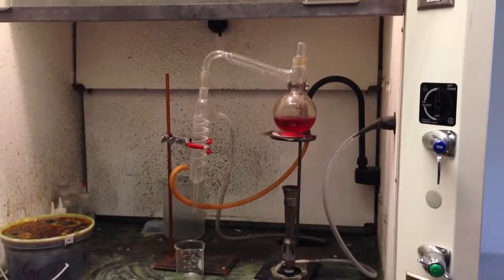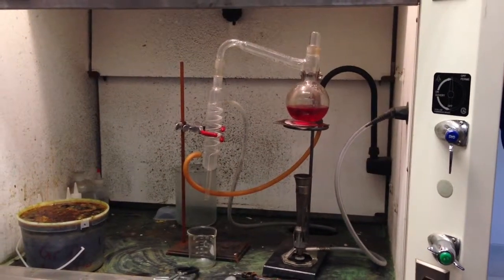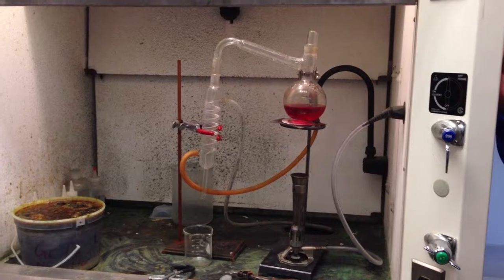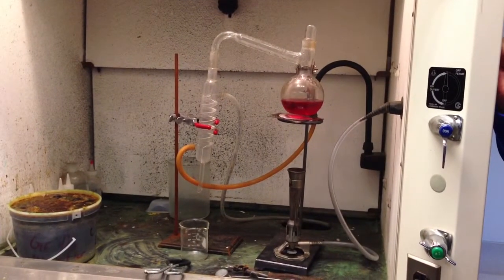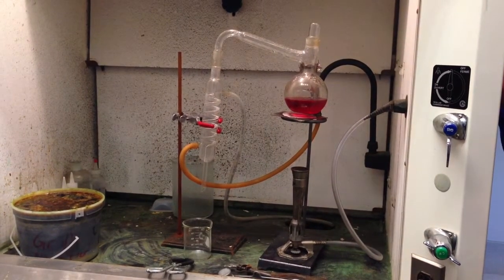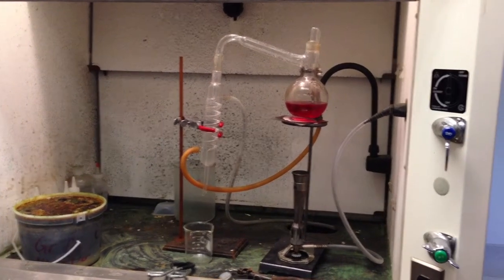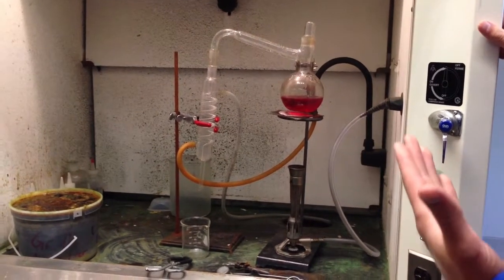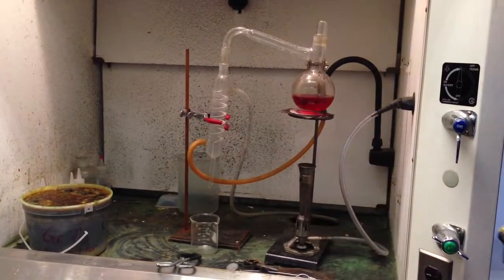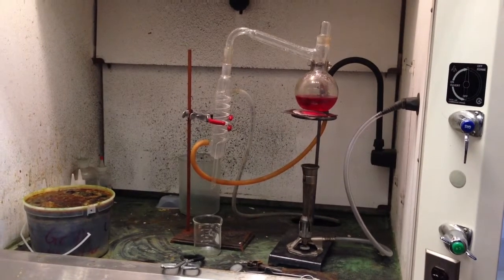Okay. So this apparatus here is called a distillation apparatus, but because it's a long name, it's usually shortened to just still. And when you hear the word still, what do you think of? Actually, I'm thinking more like somebody in the bayou, in a cabin, making moonshine. Okay, so this is how you make hard alcohol, or you concentrate alcohol. So what we've got here is a mixture of water and some red food coloring, and I'm using red food coloring simply because it's nice and visible.